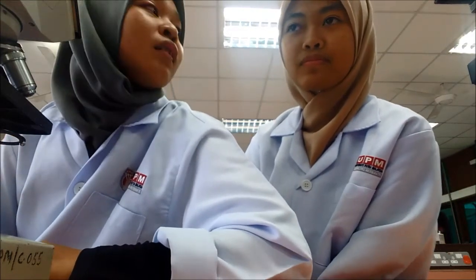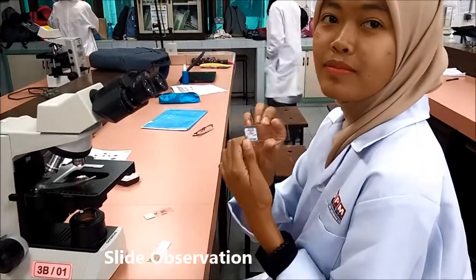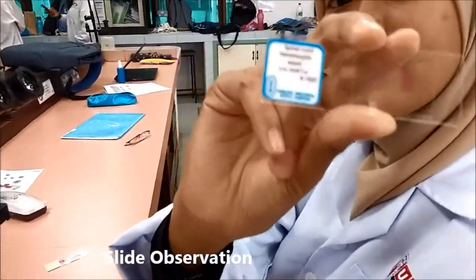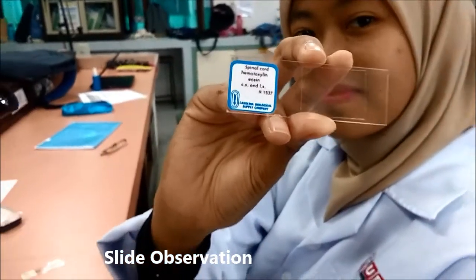Okay, so basically from the information from the lab demo, we only have a slide observation today, and the total slides we have is seven. Now we have to observe the slide of spinal cord.